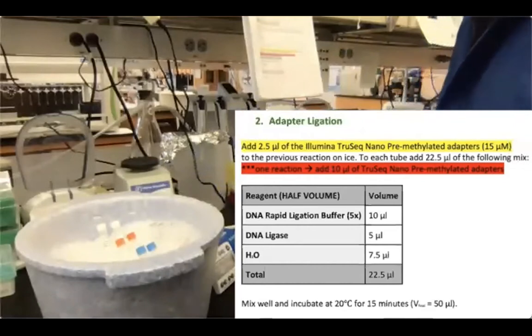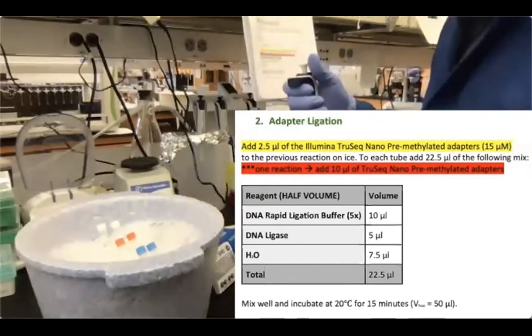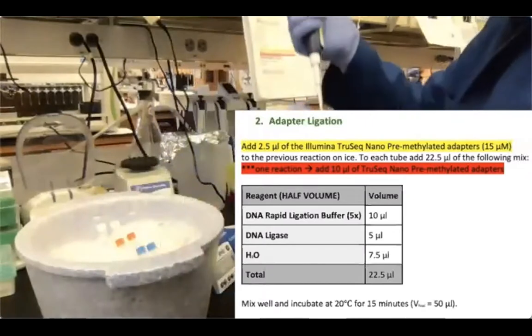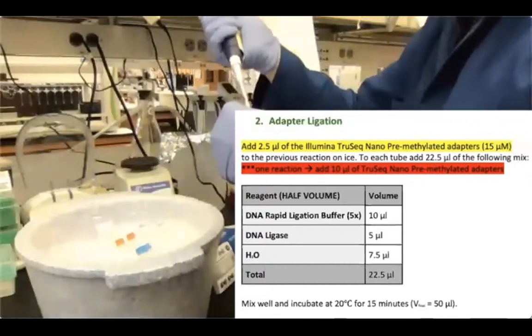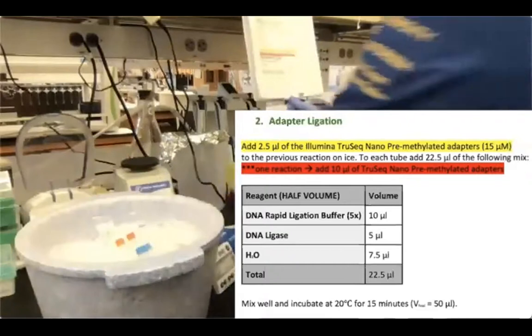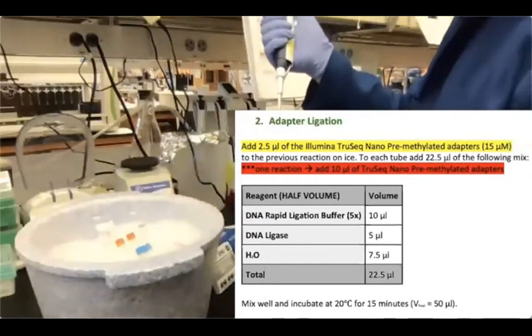So the first thing that I do is I add the adapters to my library, and then I take notes of what adapters I use for each sample. So in this case, adapter 9, I'm gonna add it to my library A, and adapter 10, I'm gonna add it to my library B.